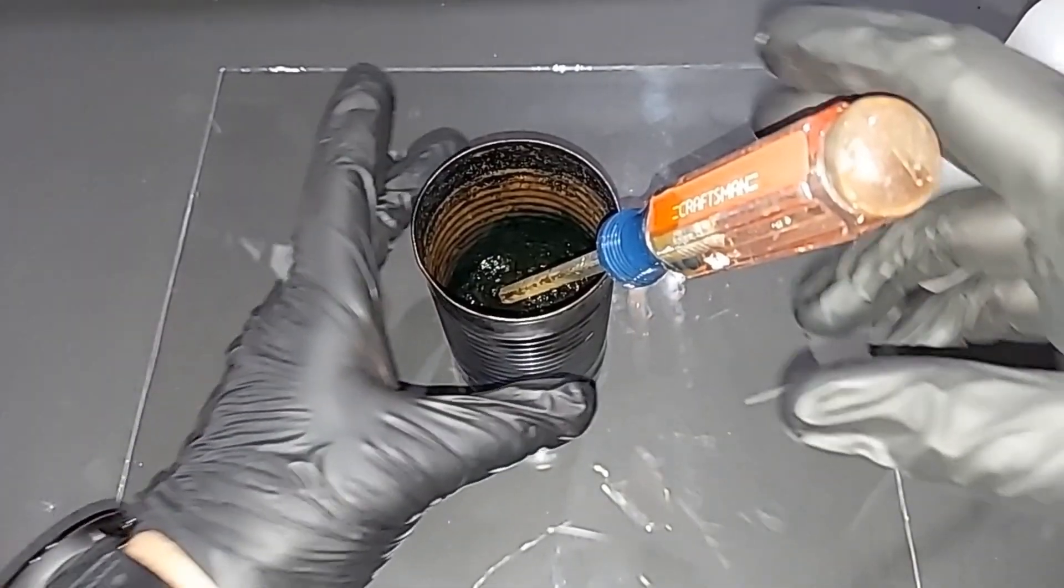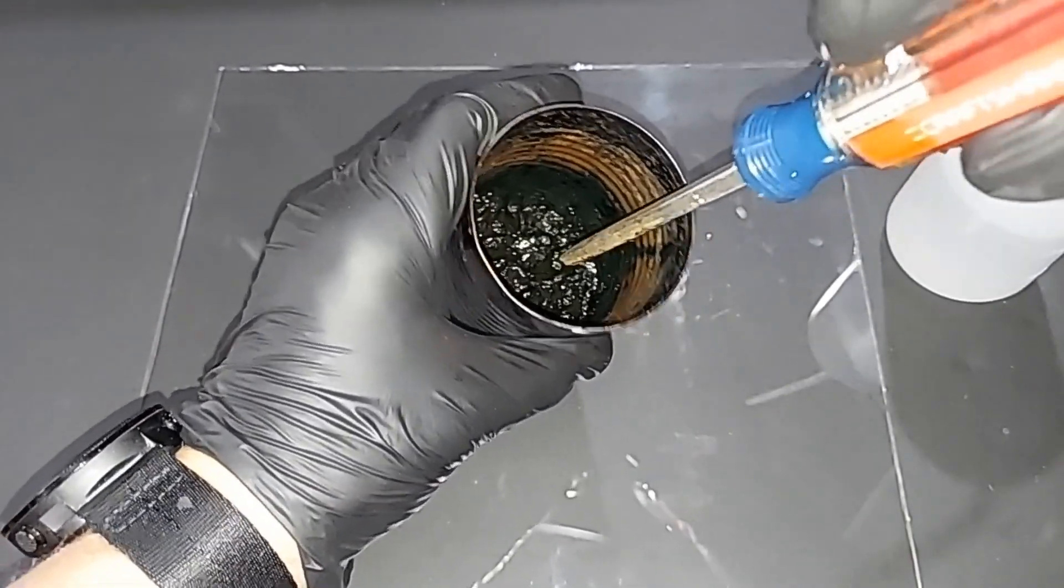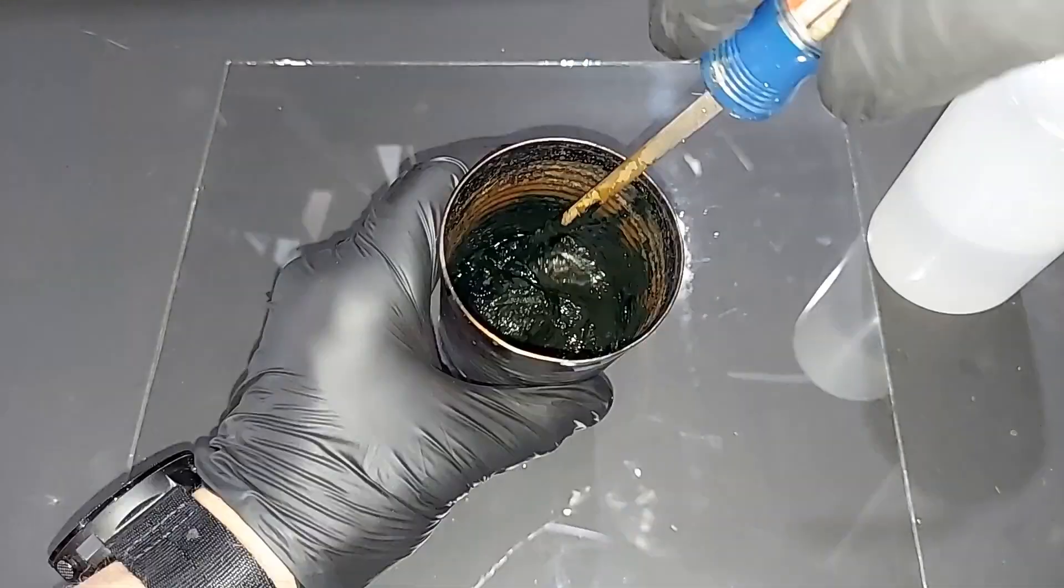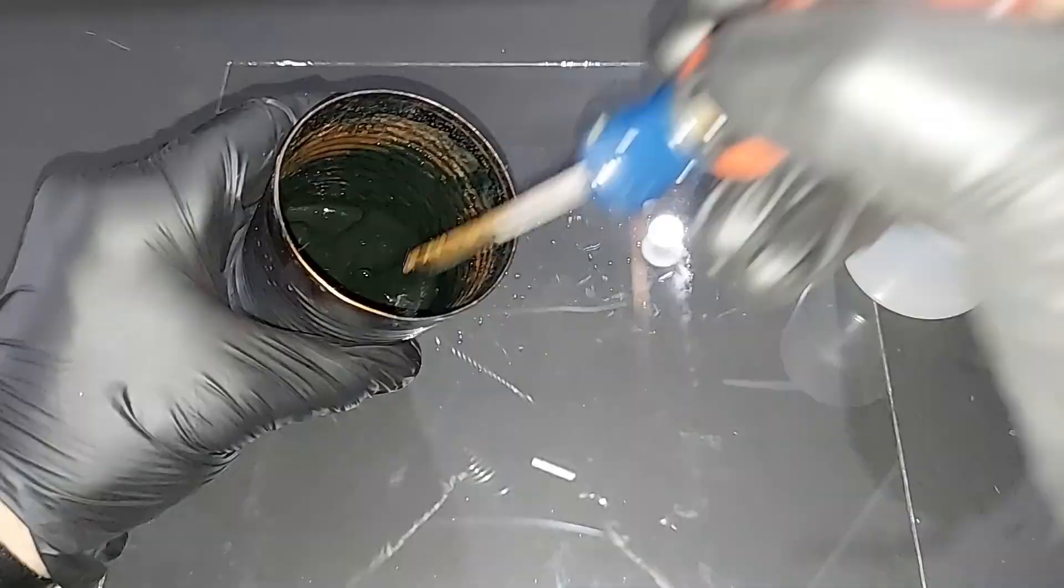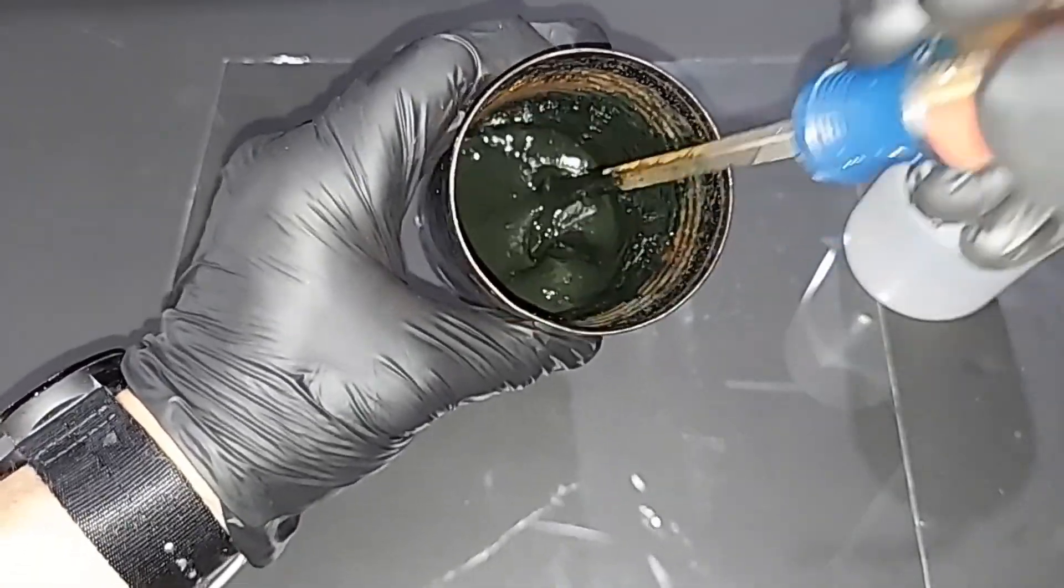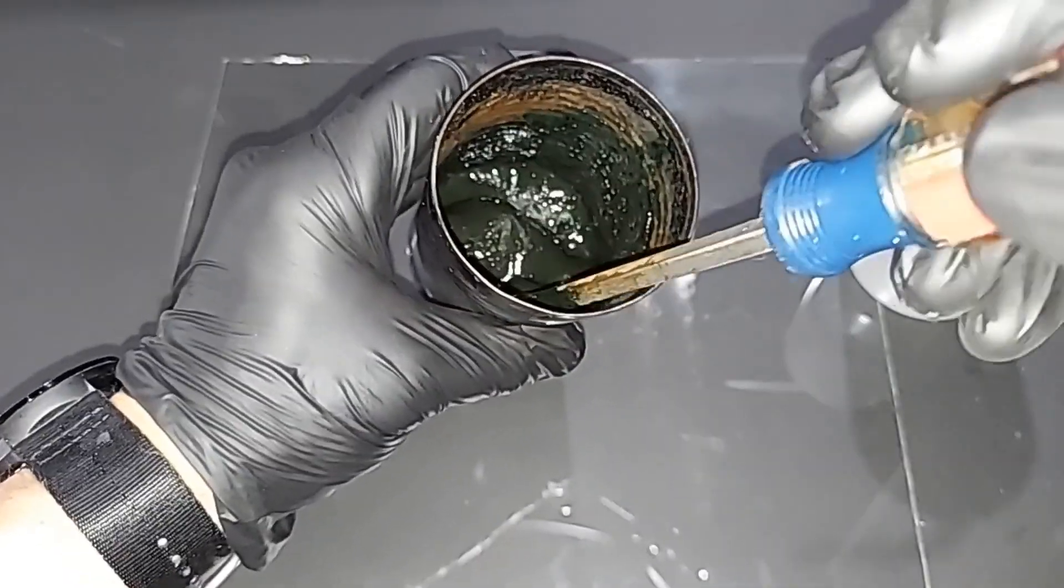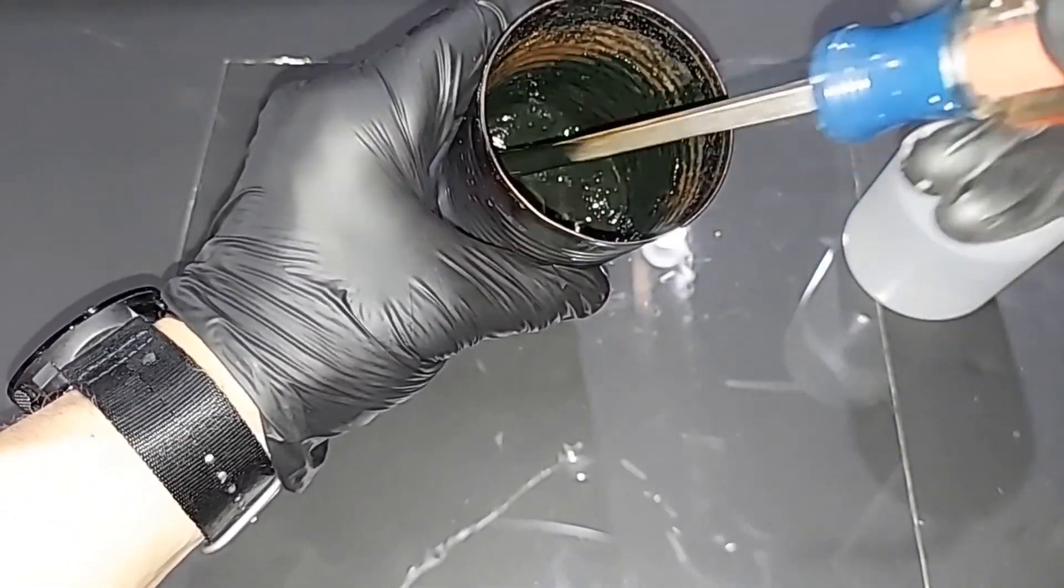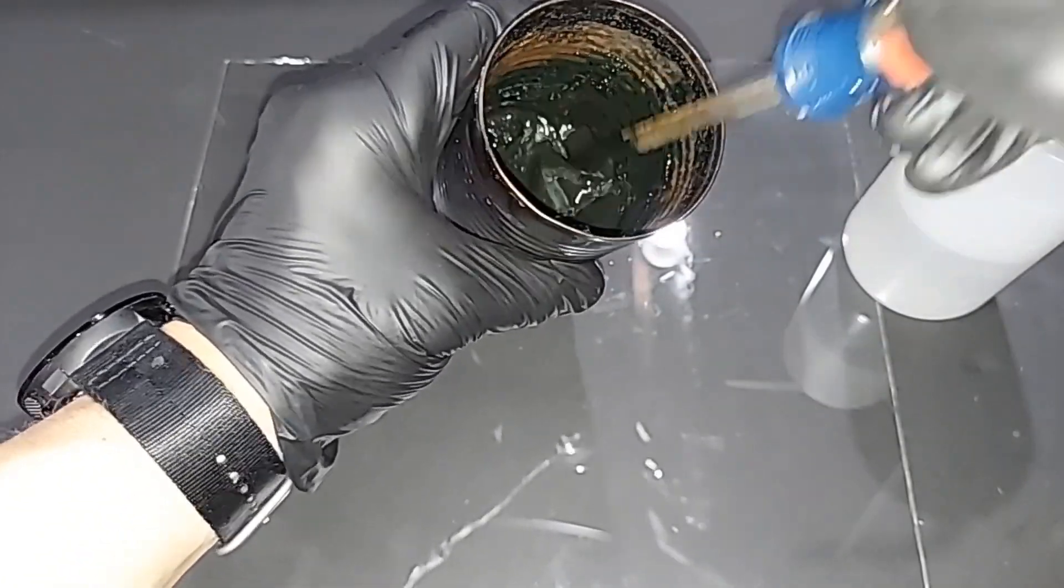This was sitting for only about 10 or 15 minutes, and I just started to drill into it like this, and it started to break apart. I've managed to break all of the chunks off the edge, and a lot of this has turned into a slurry. There are a couple of big chunks, although they're mobile. I need to break down still.